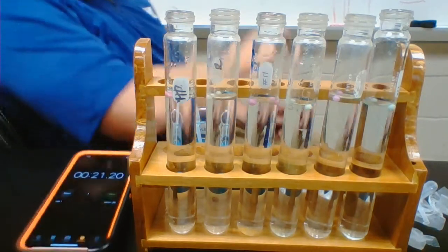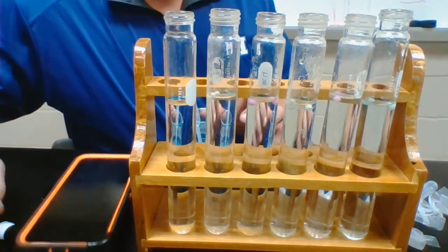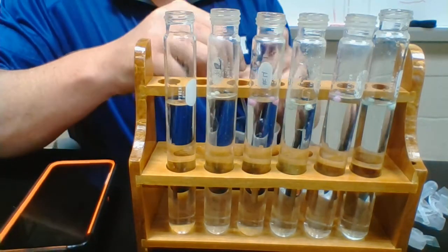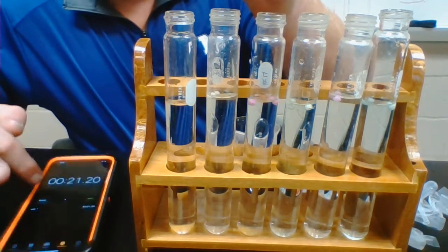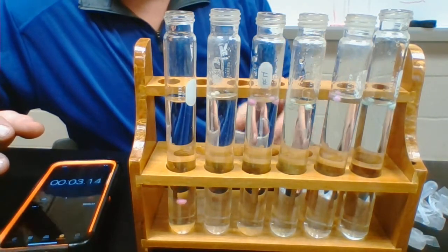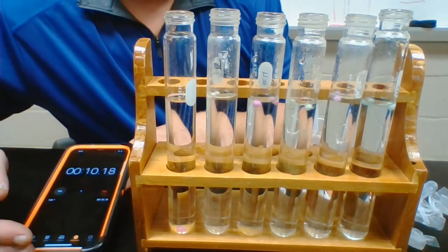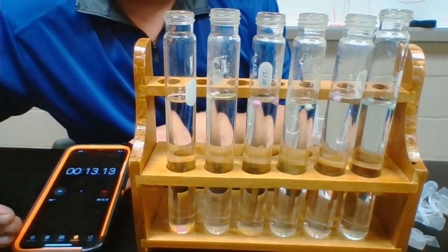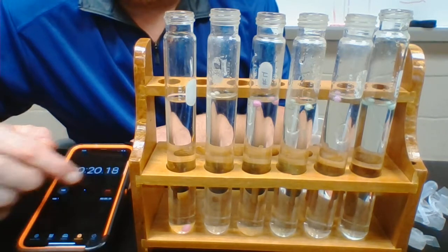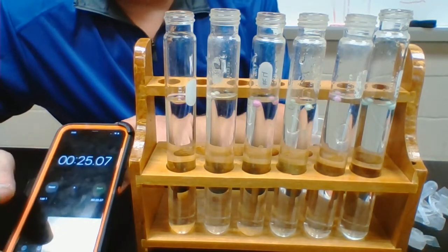So I'm pulling this one out, putting a new one in. Now we're going to our last one, which is the orange. This is going to be the 10% salt solution. Let me clear my timer. Get ready to go, and one, two, three, drop. Almost looks paint on it - it's orange, I promise you. See? 10% salt, twice the salinity as the 5% salt. Let's see how much more that will denature the proteins. And stop. So 25.07. It did take longer.